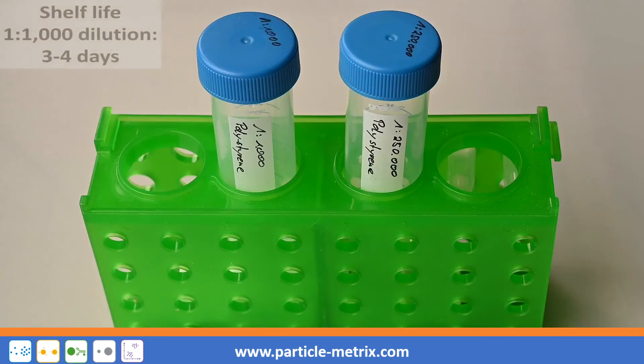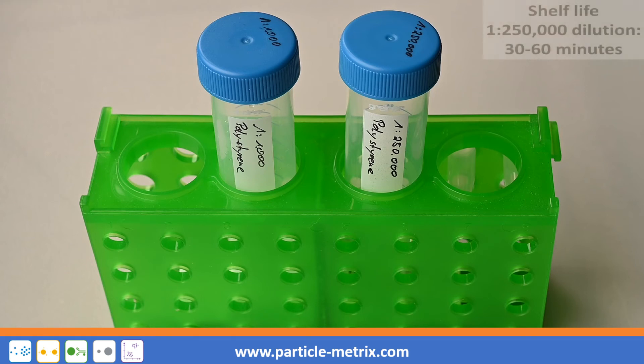The shelf life of the 1 in 1000 solution is about 3 to 4 days when stored at 4 degrees. The shelf life of the second solution is only around 30 to 60 minutes after preparation.